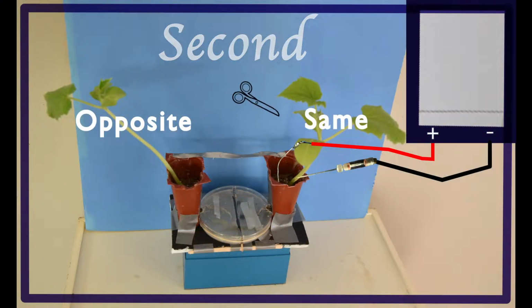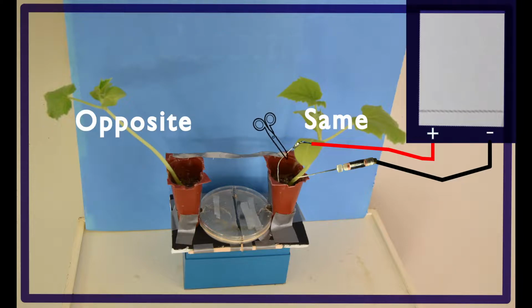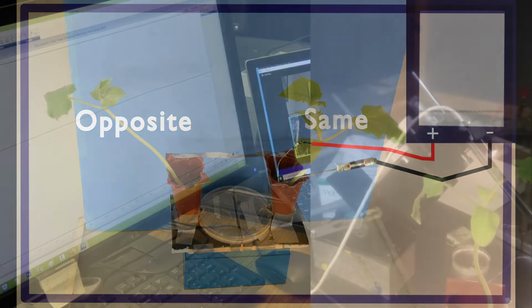Second, we administer a soil touch in the same plant. The tool we insert is a metallic scissors, and being that the soil is moist with free ions, we typically get slow and small depolarizations as the scissors are inserted and pulled out of the soil.